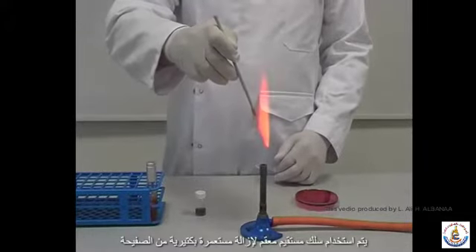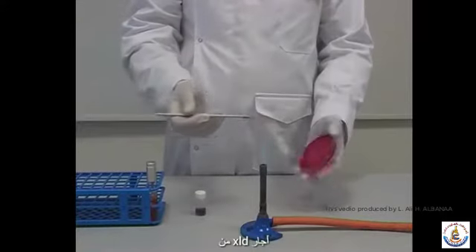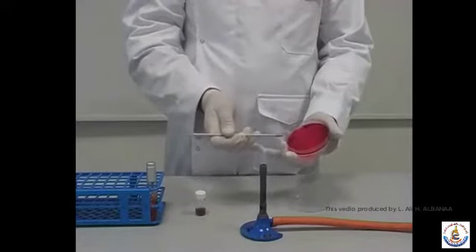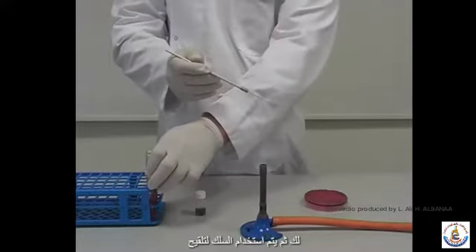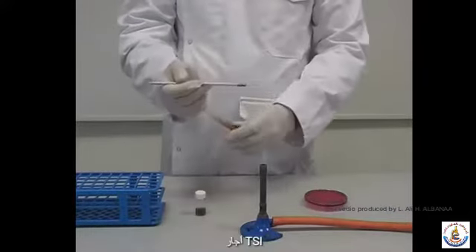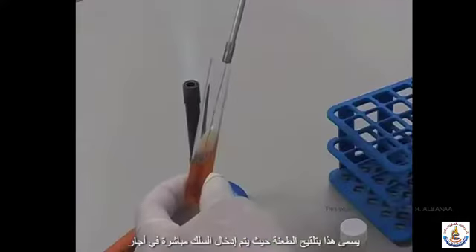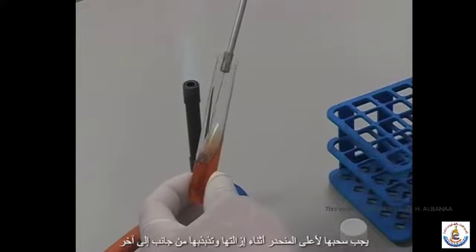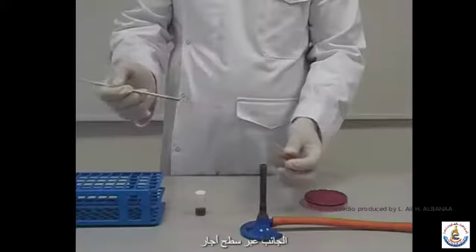A sterilised straight wire is used to remove a bacterial colony from a plate of XLD agar. The wire is then used to inoculate the TSI agar. This is called stab inoculation, as the wire is inserted directly into the agar. It must be dragged up the slope as it's being removed and wiggled from side to side across the agar surface.